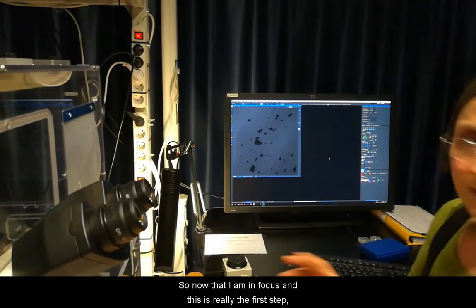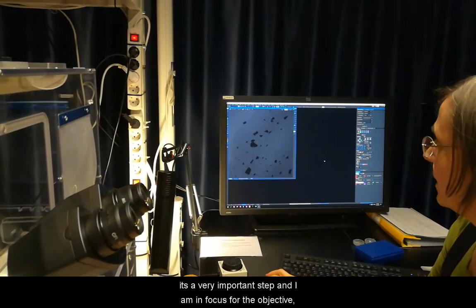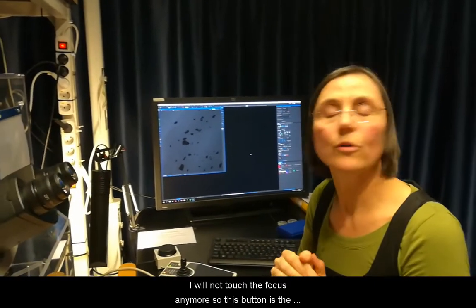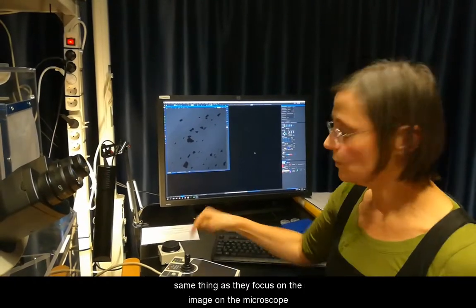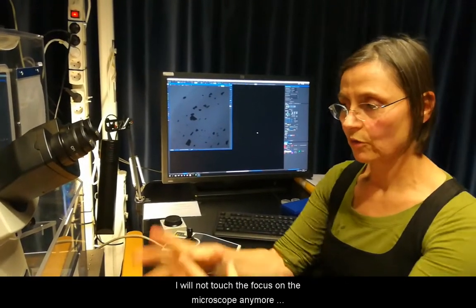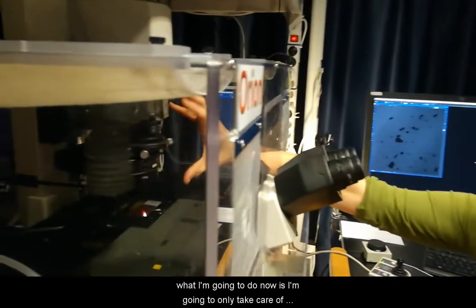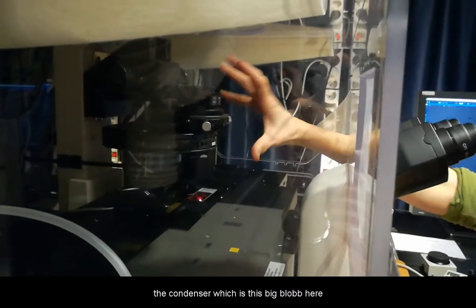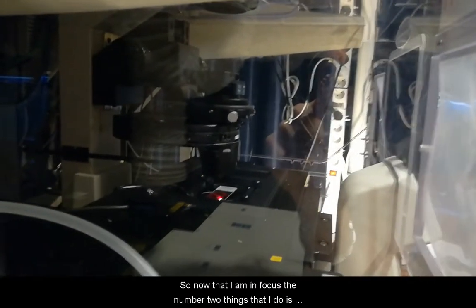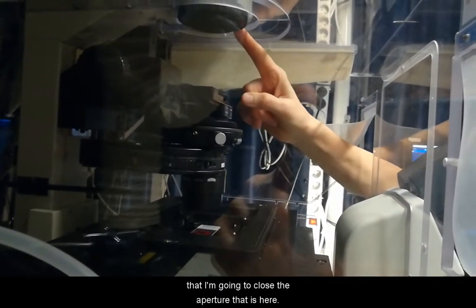Now that I am in focus — and this is really the first step, it's a very important step — I am in focus for the objective. I will not touch the focus anymore. This button controls the focus on the microscope; I will not touch that anymore. What I'm going to do now is only take care of the condenser, which is this big blob here. So now that I am in focus, the number two thing I do is close the aperture that is here.